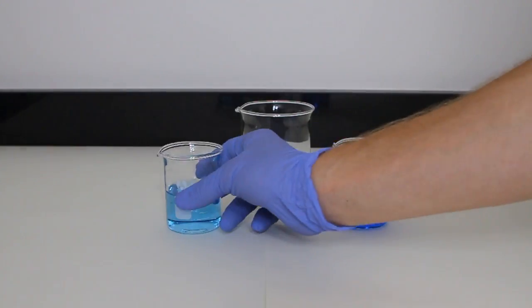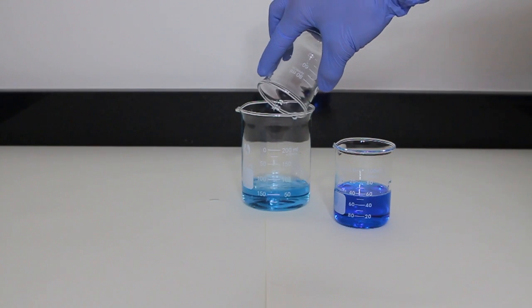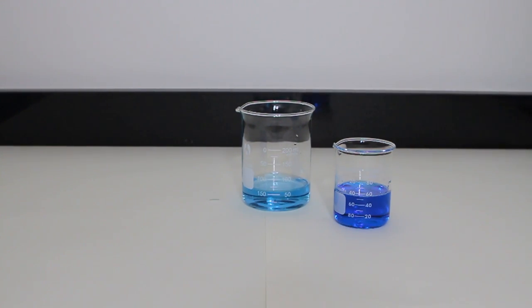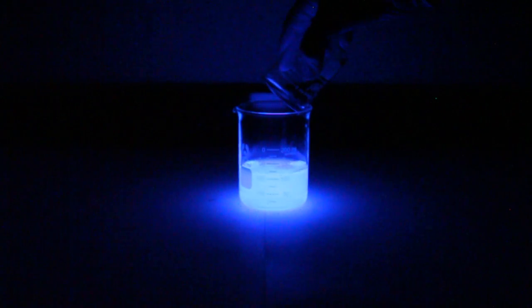Now that I know multiple colors are possible, I continue to prepare the blue highlighter. Like before, I pour the luminol into the 200 milliliter beaker and turn the lights off. A bright blue glow is produced. In retrospect, this reaction was very unnecessary since the luminol already produces blue light and nothing was changed — yet it still looks cool and does produce light.